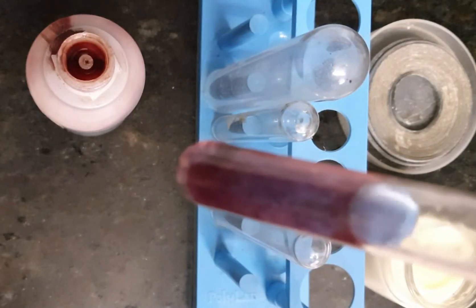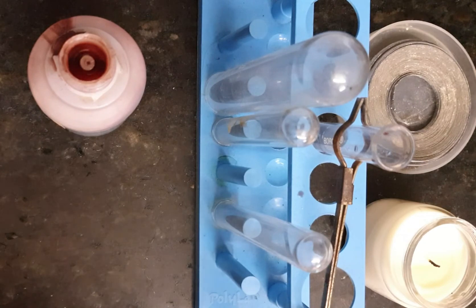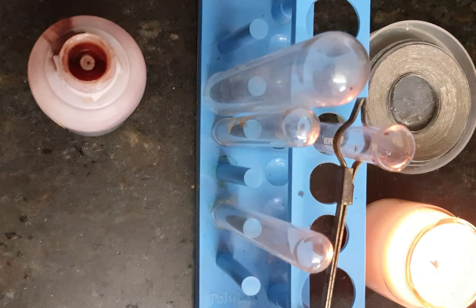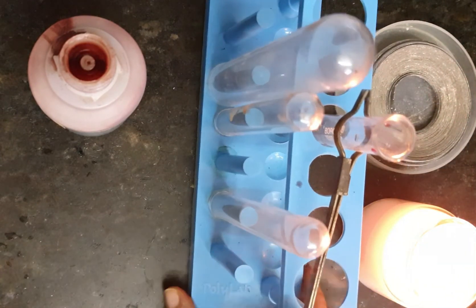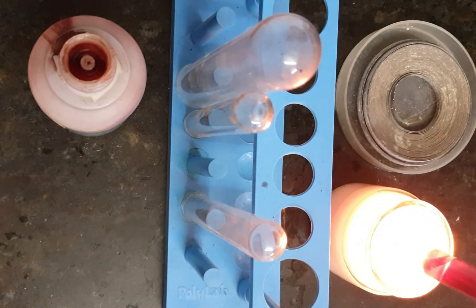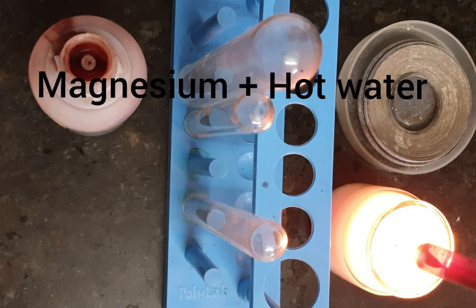First, I am lighting up the candle to warm the water. Since we don't have a spirit lamp here, I have replaced it with a candle. I am slightly warming the water up to find out whether the reaction will take place or not. Now you will see slowly and slowly that it will start changing.